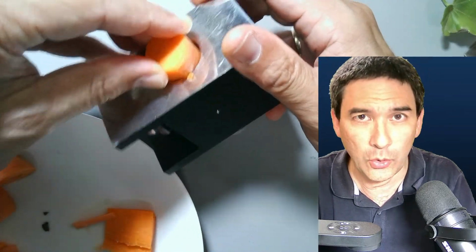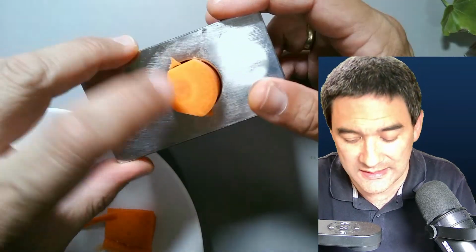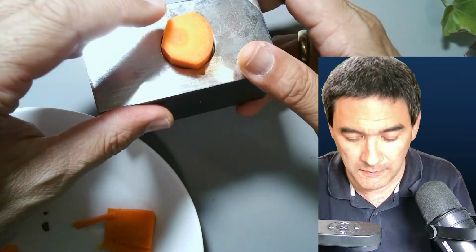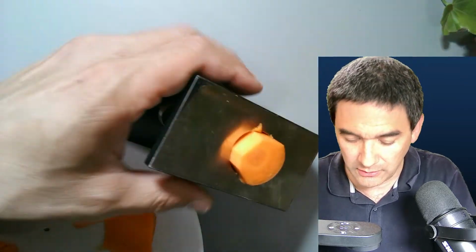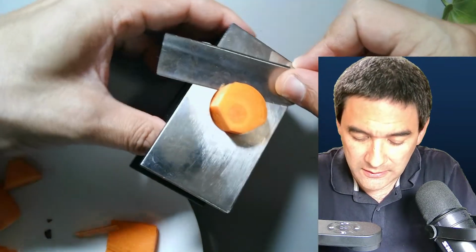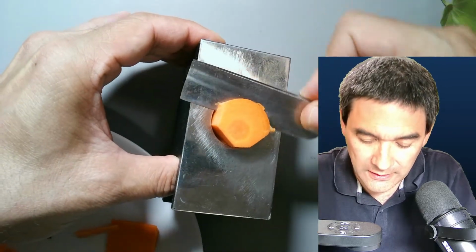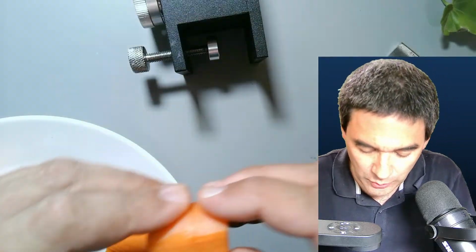Yeah, there is no tolerance, no wobbling. I know that there are some gaps here on the side as well still, okay? But maybe this works. So next thing is I'm going to just carefully cut off the excess so that I can again make a little cut to hold the leaf.